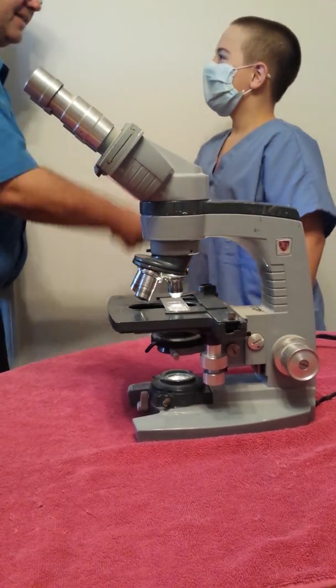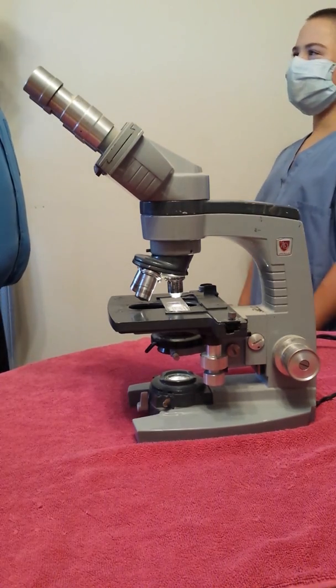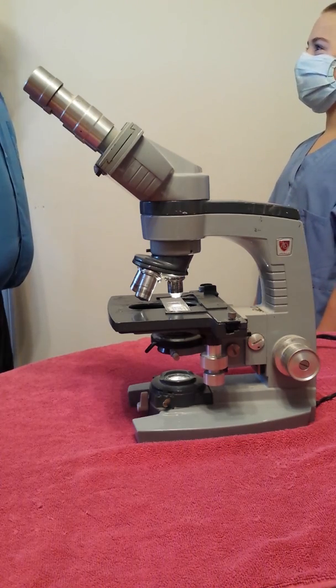Hi there, Dr. Hott. How are you doing today? Yeah, good. And so you're having problems with your microscope? Yeah, I cannot see through it. Okay, I can take care of that for you.